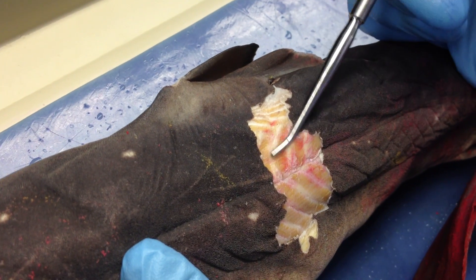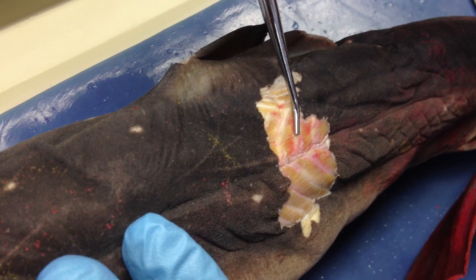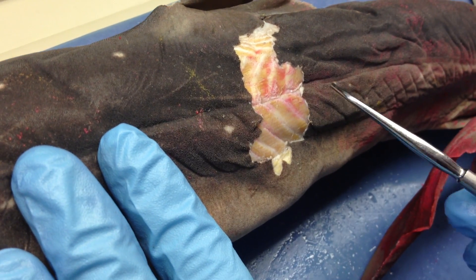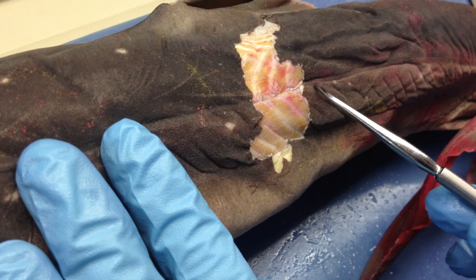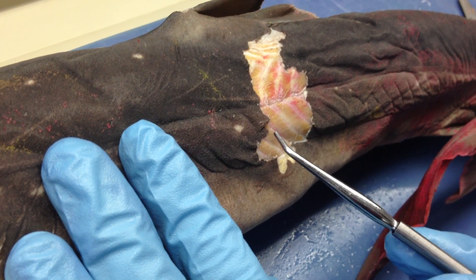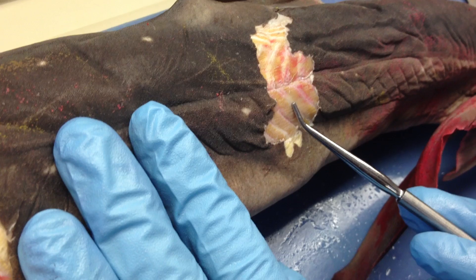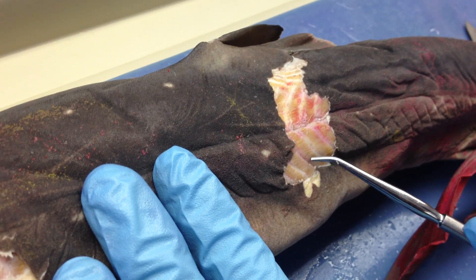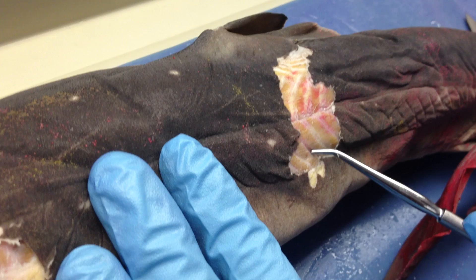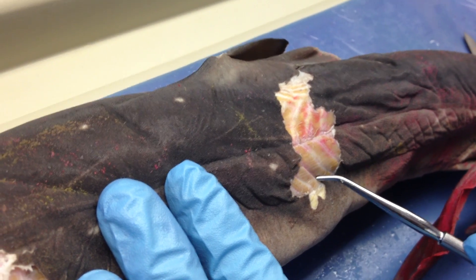First, looking at the epaxial muscles, which are right here. Right below that, right below the horizontal septum — which is underneath the lateral line — are the hypaxial muscles. Each little segment is our myomeres. In between are broad lines, which are known as myoseptums.